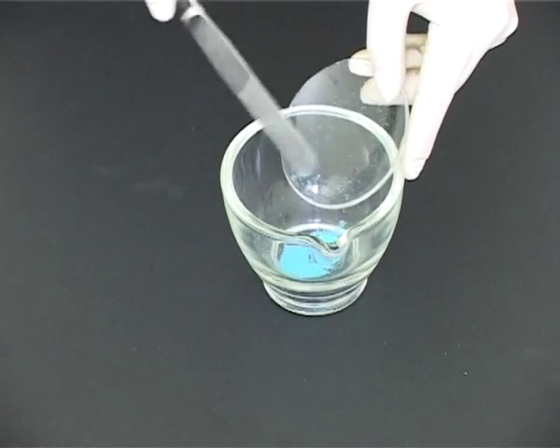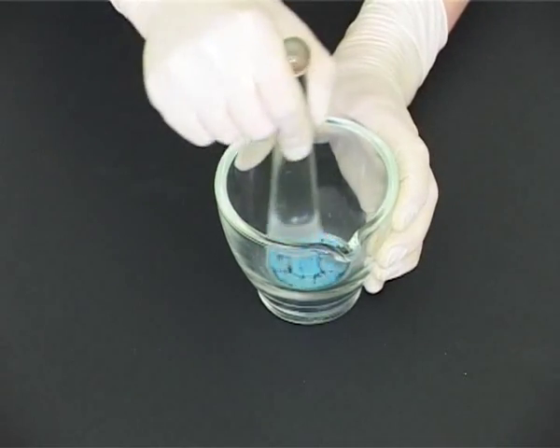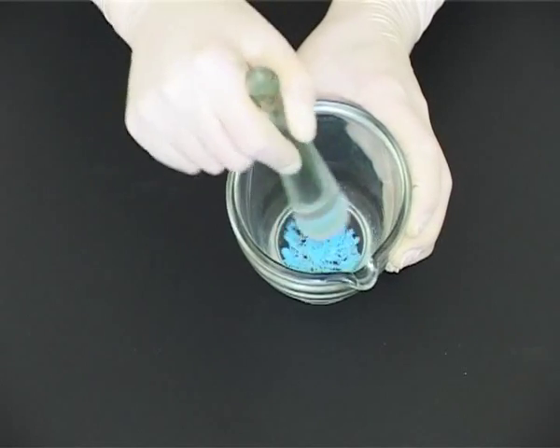Grind the powder well using a glass pestle. This will reduce particle size until a fine powder is formed. This is very important in order to produce an elegant and effective product.